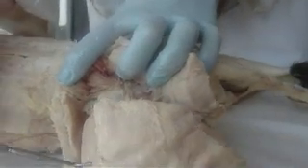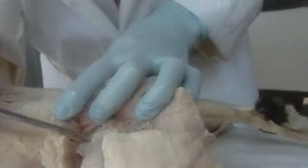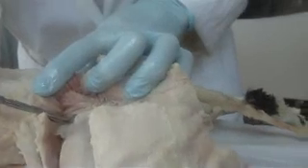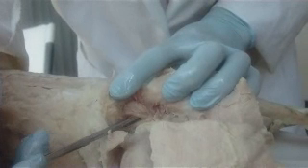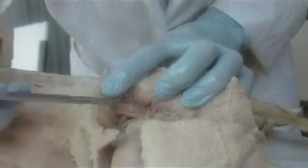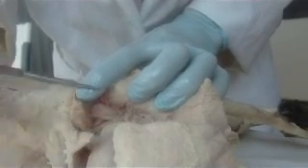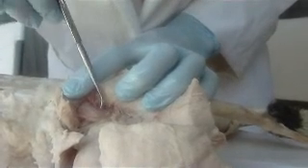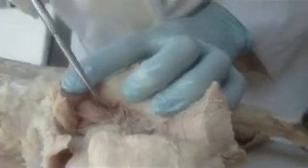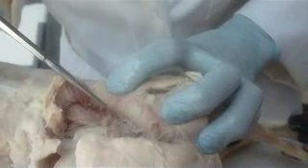We come back to the vastus lateralis, follow it down, and find gluteus minimus. See how I can get my probe under here — all of this is gemella superioris, see how it's on top of that muscle. It attaches to the hip bone here, which you can normally see, but depending on how your cat is situated you may not be able to see it. The muscle under and to the side here is your piriformis.